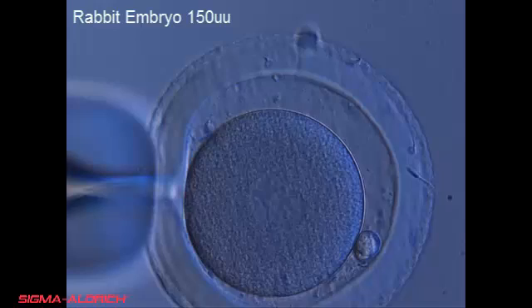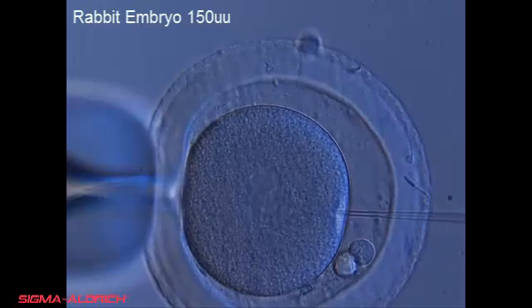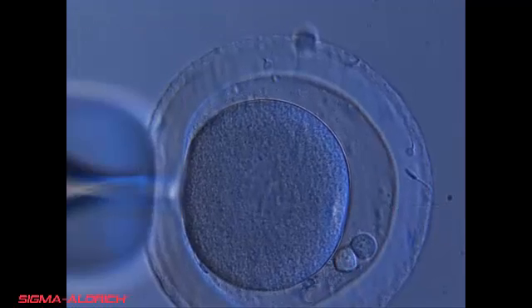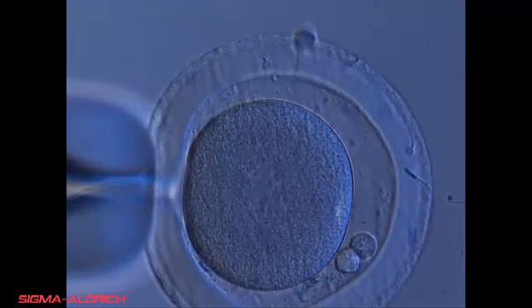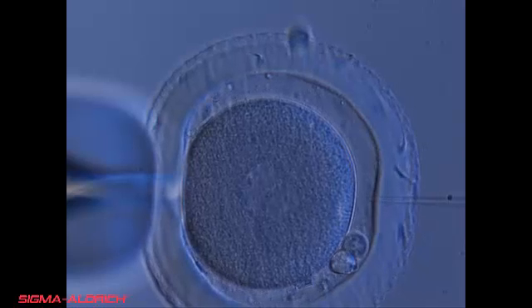In this example, once the pronuclear membrane is pierced, the embryo shifts when the needle enters, causing the pronucleus and the needle to be in different planes. The microinjectionist removes the needle and refocuses on the pronucleus and then reinserts the needle. Care should be taken when working with embryos to ensure viability.